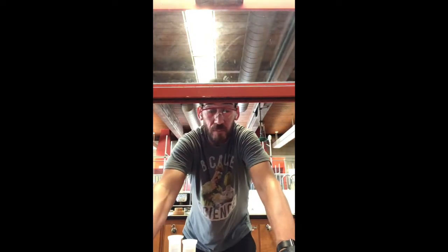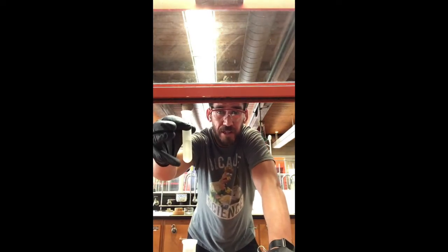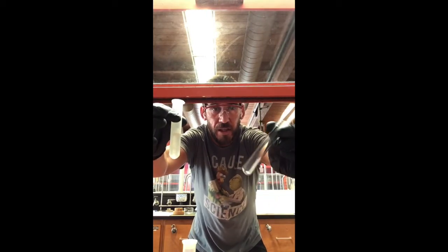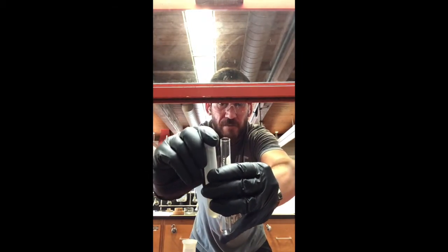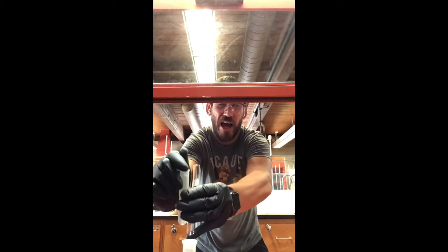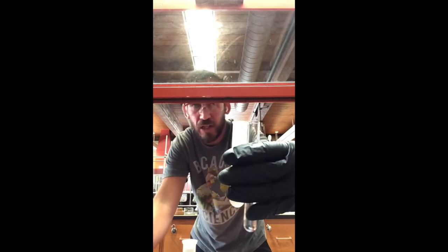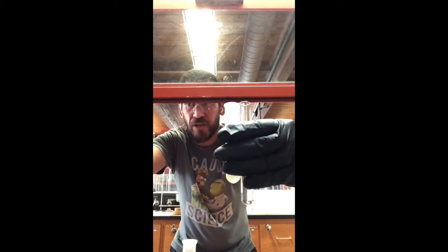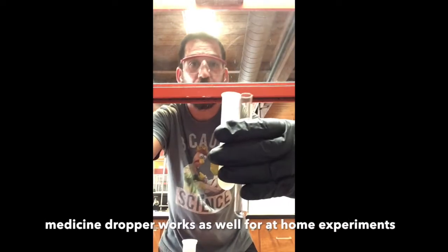All right, so now that we've got our emulsion separated, we've got clear 2 layers, methylene chloride on the bottom and water on the top. We're going to go ahead and transfer it to this lovely clean test tube. And obviously, you've got to take that cap off. Okay, I'm going to hold it with one hand, so that way they're side by side, very close to one another. And I'm going to use my pipette and bulb to transfer the 2 liquids.